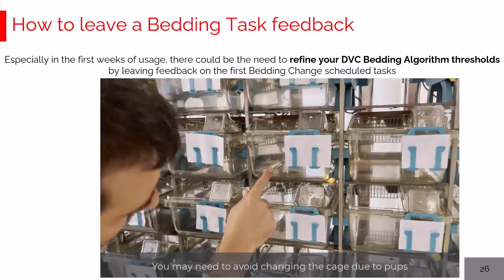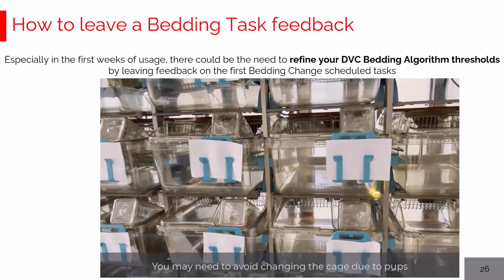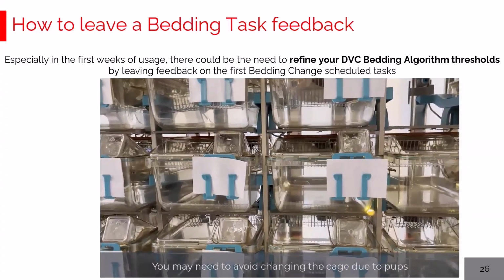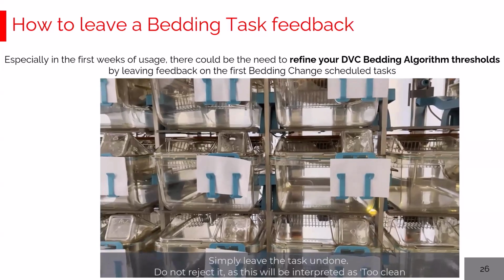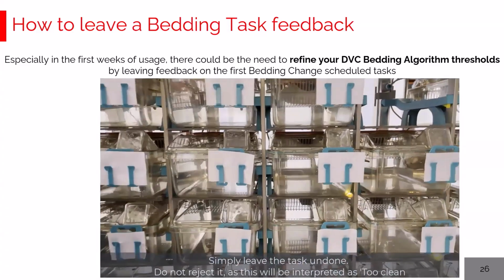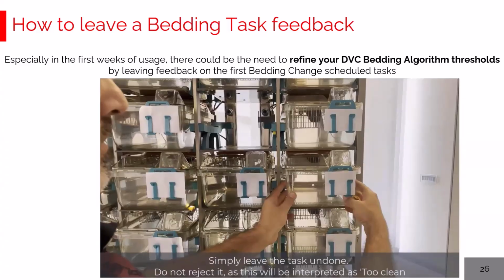Last potential feedback to leave is about, for instance, you don't want to change the cage because there are pups, so you don't want to disturb this cage, and you don't have to reject the task because obviously it's not too clean, but simply you don't want to do it because there are pups. You don't want to leave a too dirty feedback, and you don't want to change. So simply leave the cage as it is. And this is for us a feedback that you didn't change for a specific reason.